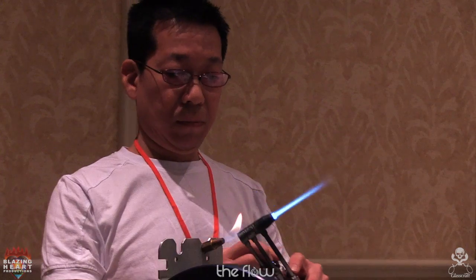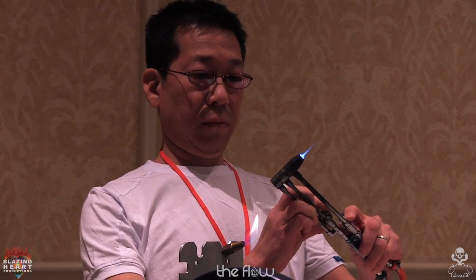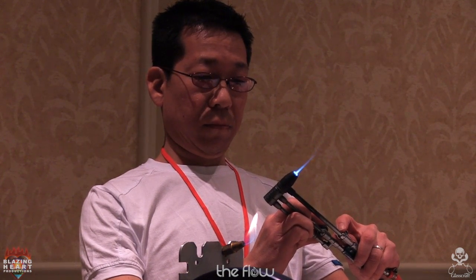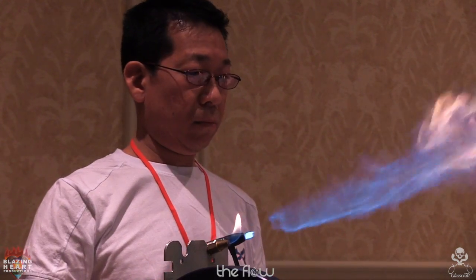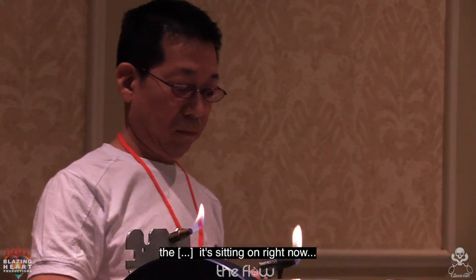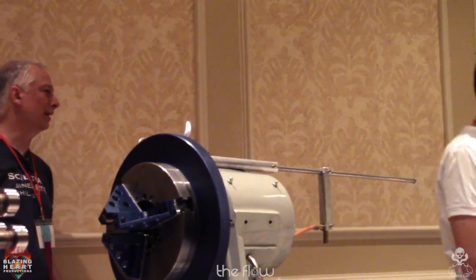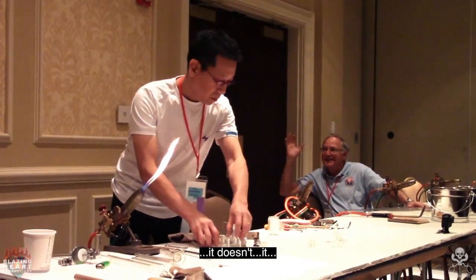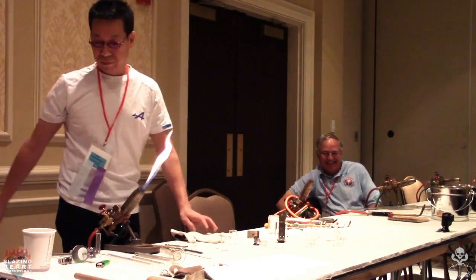So he's got 1 gas and 2 oxygen. So you get like a narrow center fire, and then you open it up. Yeah, there we go. Sitting on right now, that's already ground before it's sealed on. The grinding is done before it gets sealed on. That's correct. No distortion. You got to be good. You can't get it too hot, otherwise it'll warp.